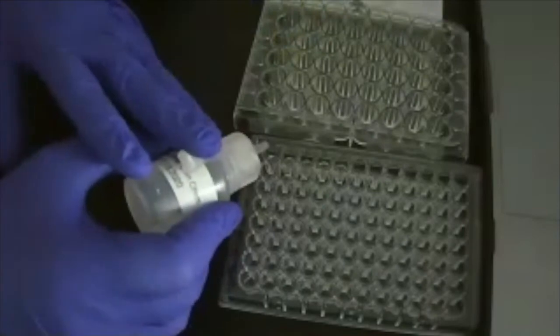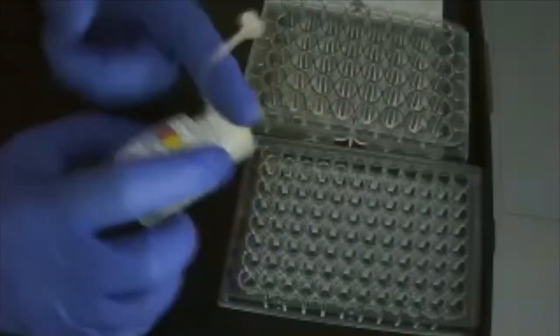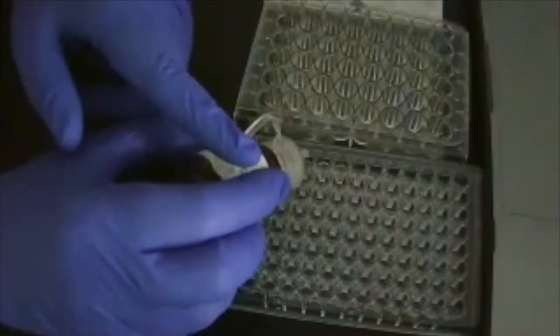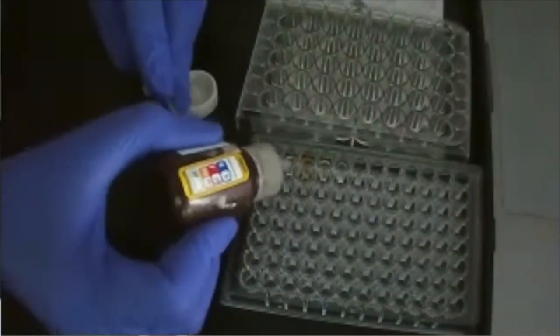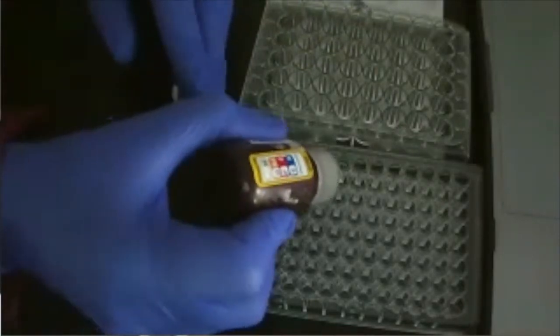Okay, so that is the luminol, and now I'm gonna add them one at a time. Okay, so here's the HCl. Here's the NaOH. Here's the bleach. Here's the hydrogen peroxide. Okay, and then DMSO. So we continued testing combinations of reagents until the students had a good idea of how things reacted with each other.